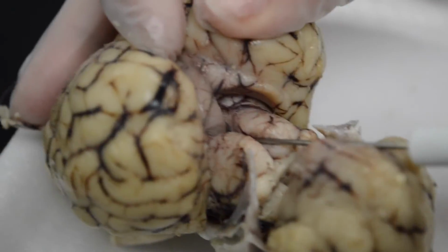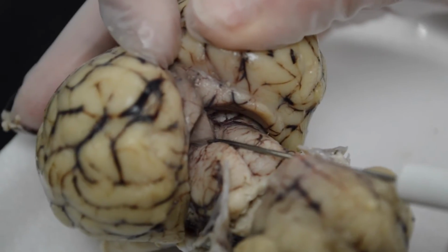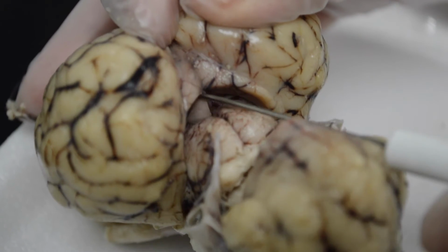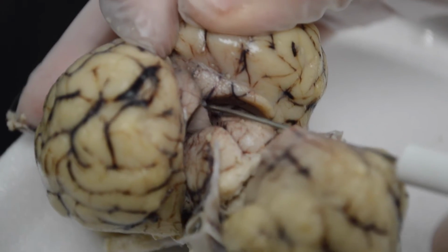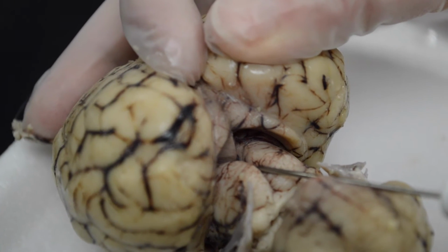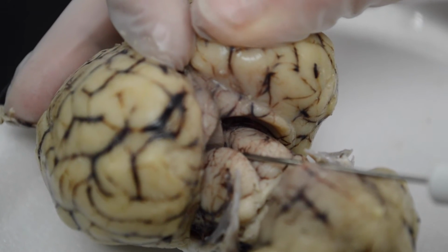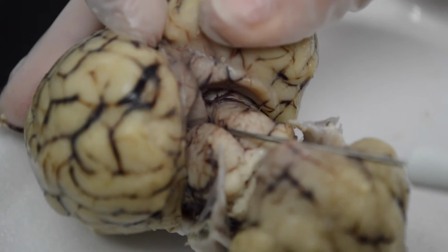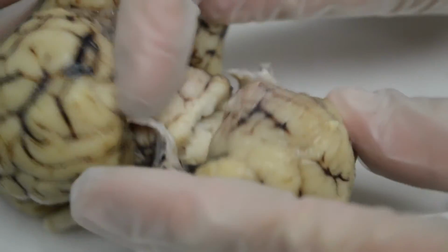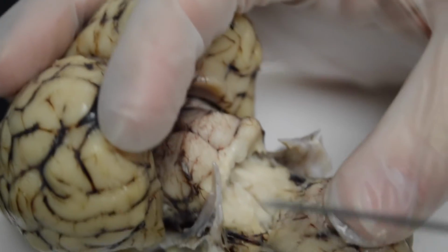Just above that, very deep in there, you will see a structure that's part of what we call the epithalamus. It's the pineal gland, and it comes to a point there. You see the very tip right here, closest to us, and it sits on top of the corpora quadrigemina. And the pineal gland has to do with sleeping, right? Regulating the release of melatonin and sleep. So that's the pineal gland there. There, that's a good view.